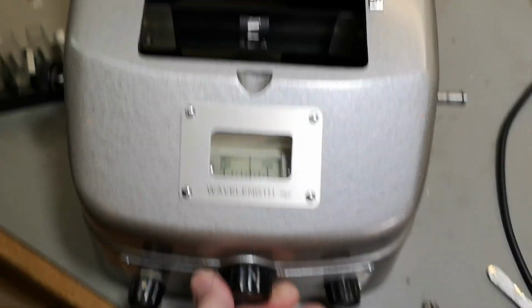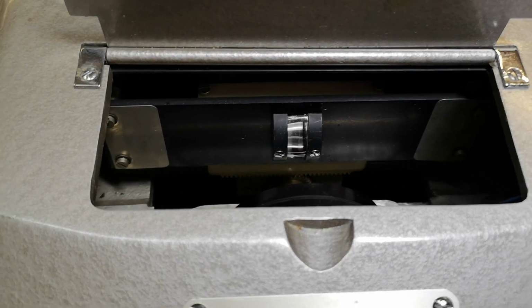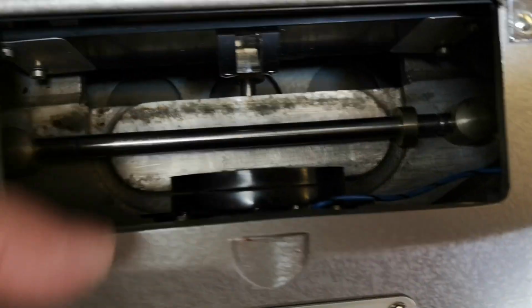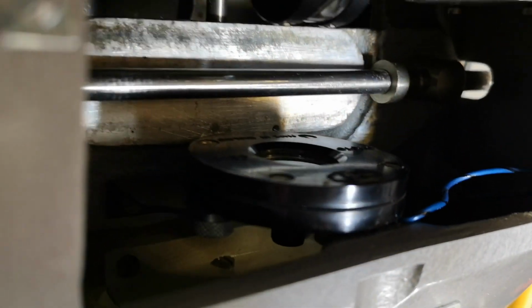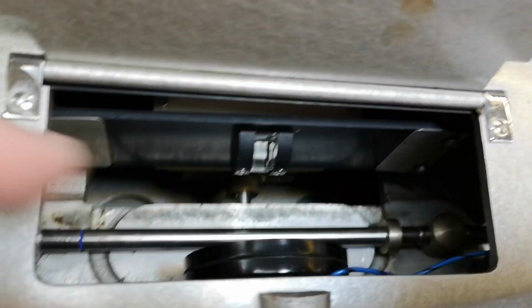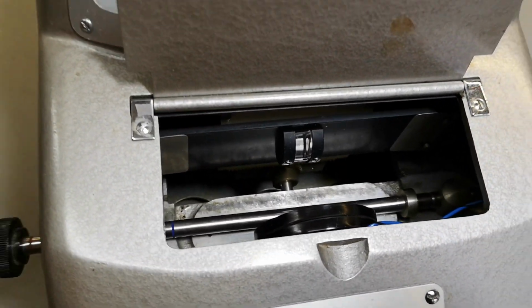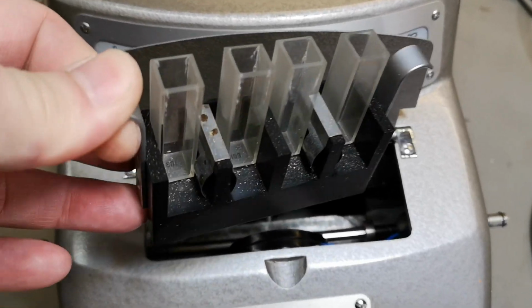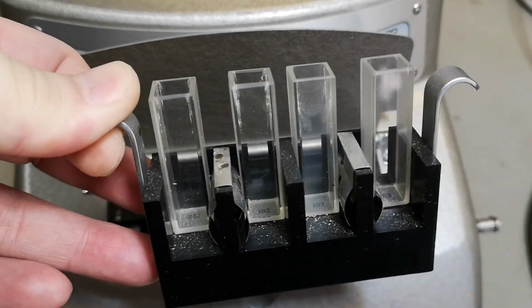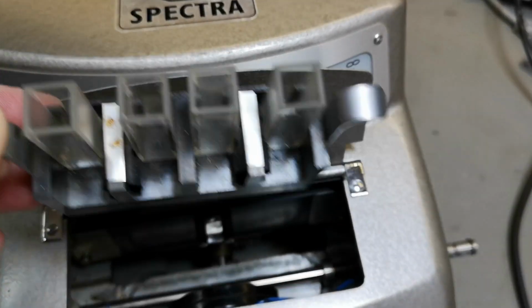And when I dial this, something moves in here. There's probably some light going in or out here, and there's probably a light source or a detector or some stuff here. I don't know. Got some optics. And this will be the sample tray. Some special glasses. You can take these up and put in some liquids or whatever you want to sample.